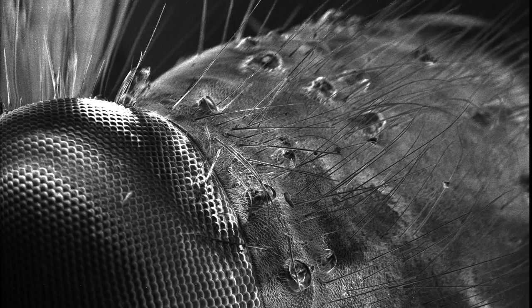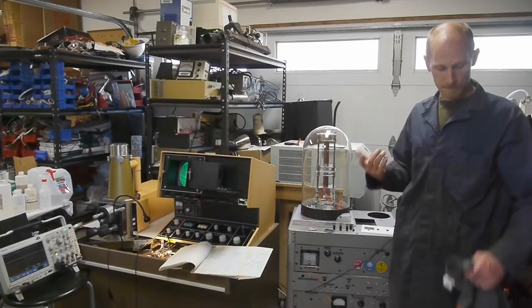So in this video today I'm going to talk about how I'm getting digital images off this piece of equipment and into videos.